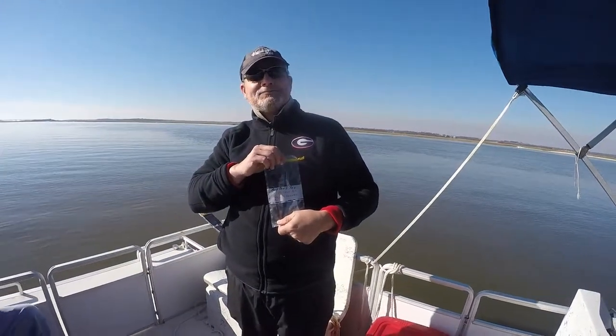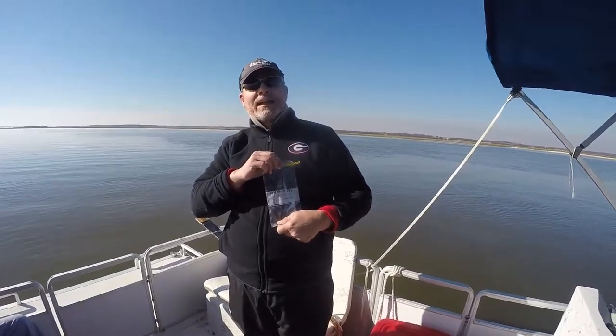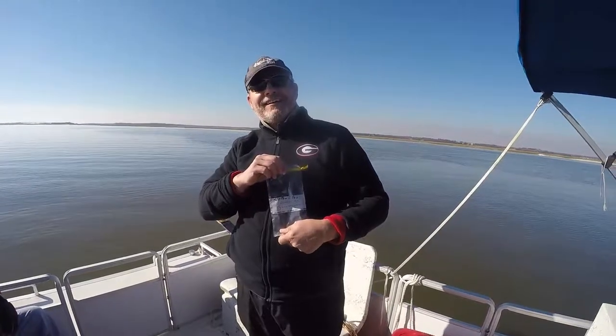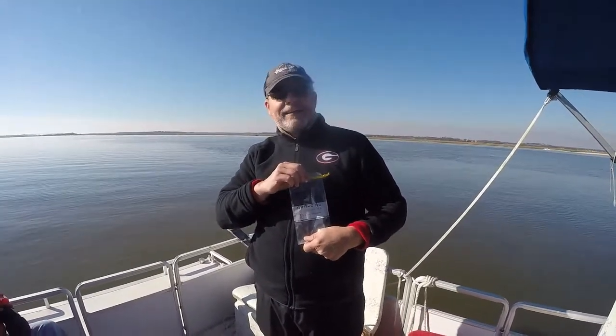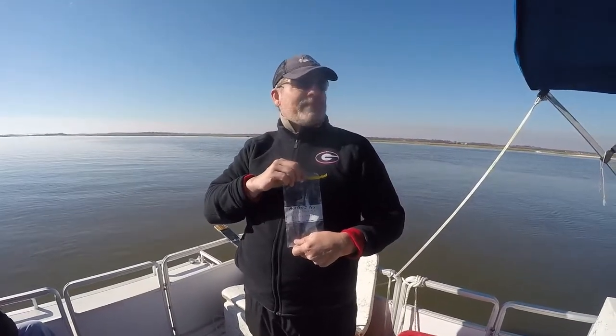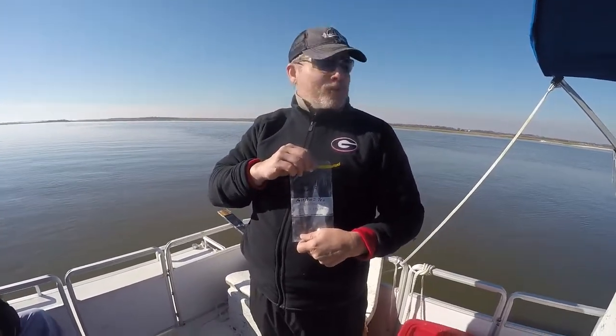This is Sampling Primer Take Two. We still don't have gloves, but we're going to go anyway. We're at sampling point one in the south. This is the Amelia Island Sailing Club, St. Mary's Rivers Keepers Group.